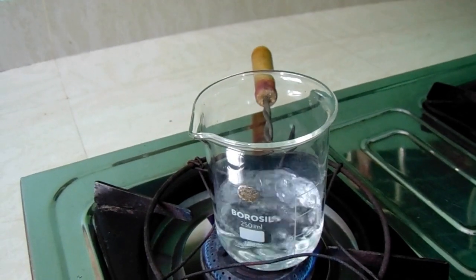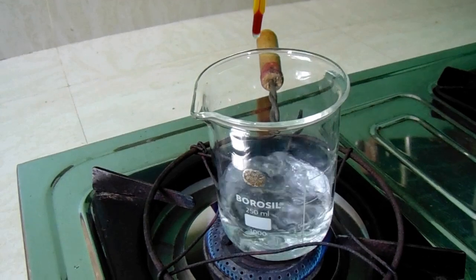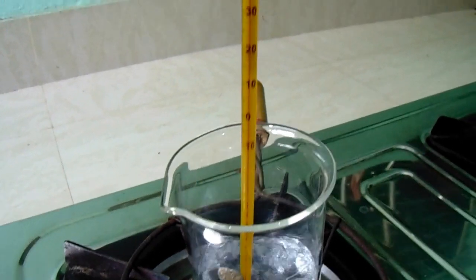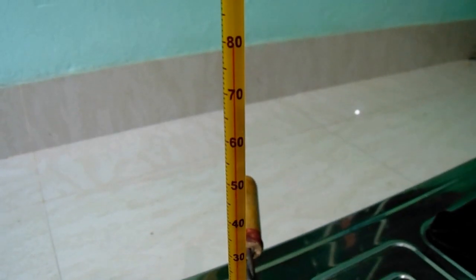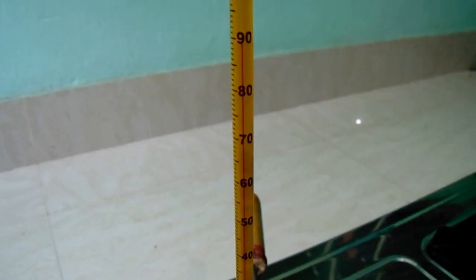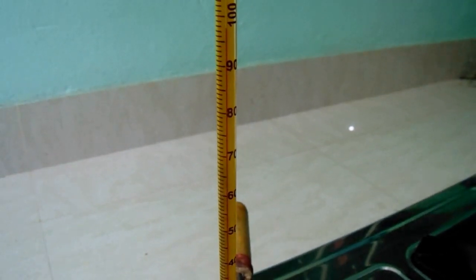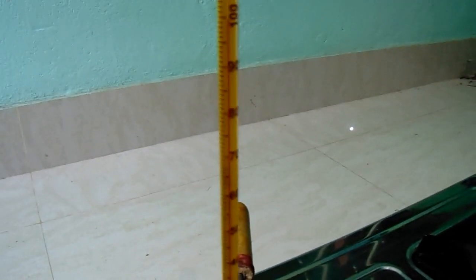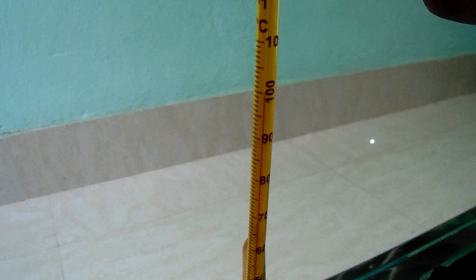Pure water is heated up to boiling. We dip the thermometer and the temperature rises: 50, 60, 70, 80, 90, 95, and goes up slowly to 100 degrees centigrade — and now it is constant. The temperature is not increasing anymore; this is the boiling temperature.